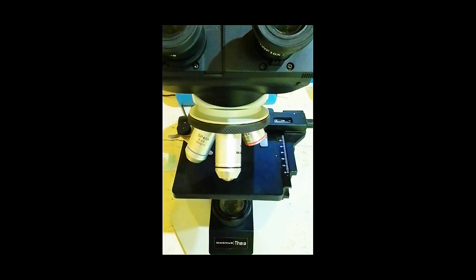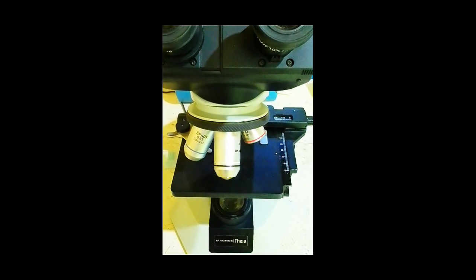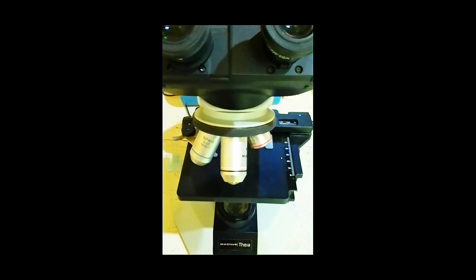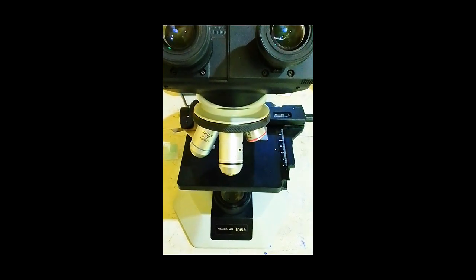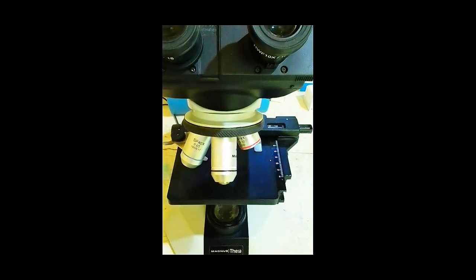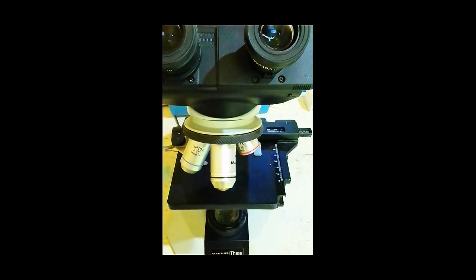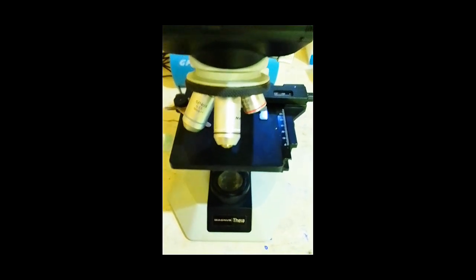3. Examination of urine samples. Laboratory professionals use microscopes to examine urine sediments for the presence of cells, crystals, bacteria, and casts, which can indicate urinary tract or kidney diseases. 4. Analysis of stool samples. Microscopes help identify parasites, parasite eggs, cysts, and other abnormalities in stool specimens.